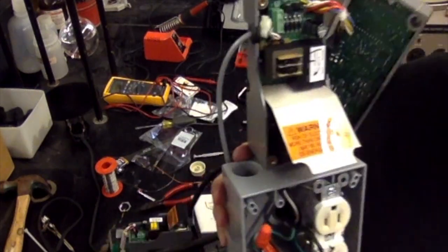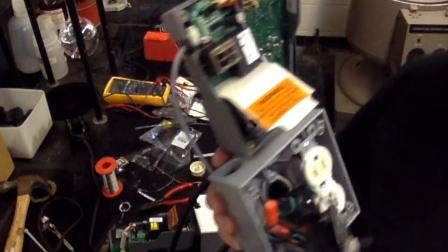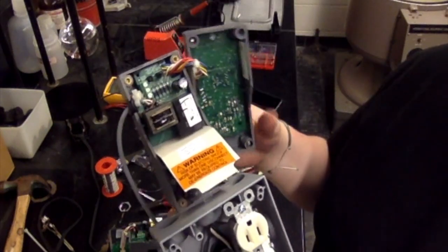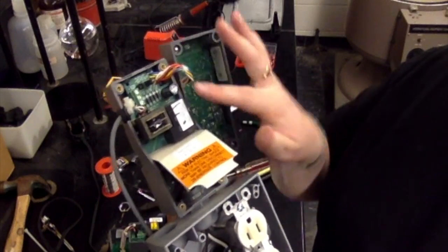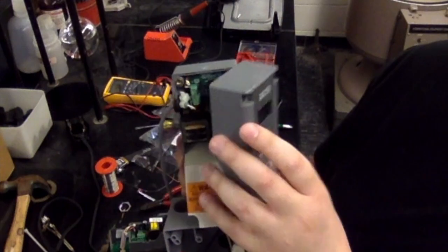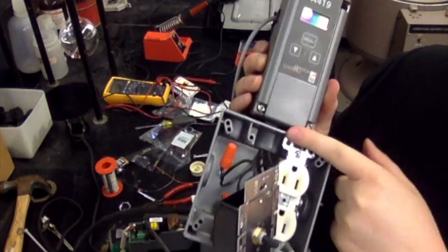So I'm going to go ahead and do that. And once that's finished, you're really done with the wiring. The hard part is over. So I'm going to go ahead and make that connection there. And then I'll go ahead and close this up and put the screws back on.